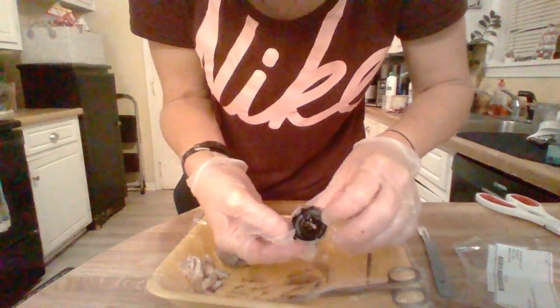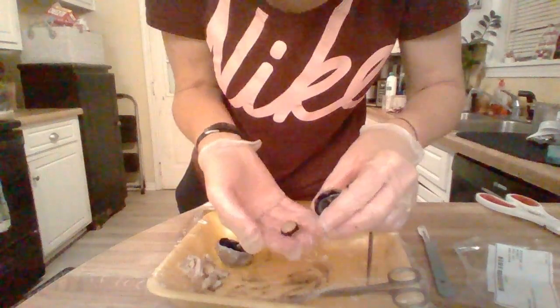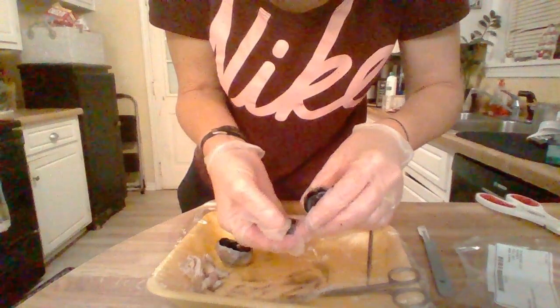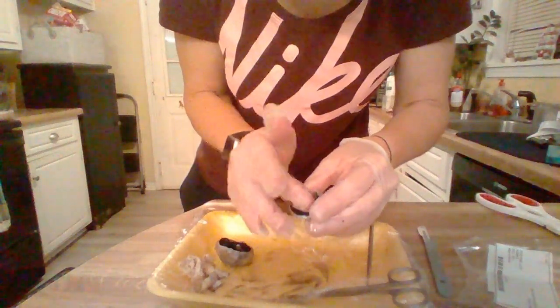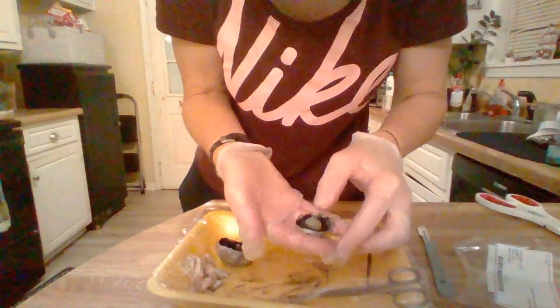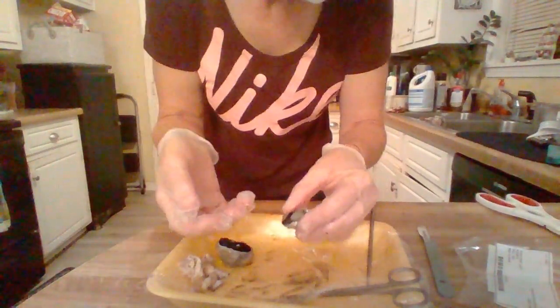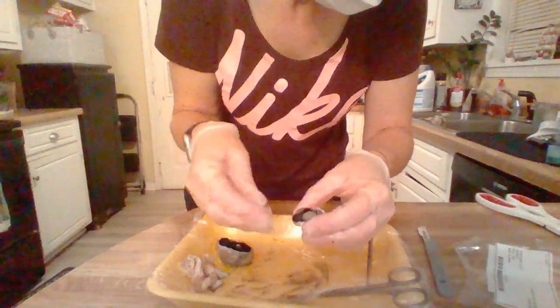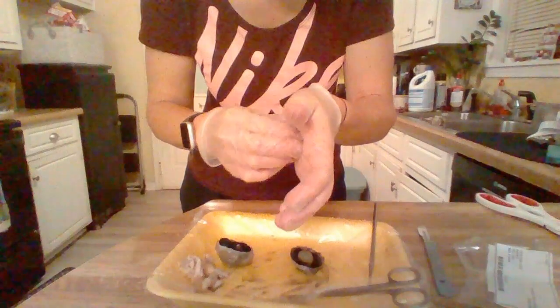You can see here the iris, and then the pupil, where that would be. And here we have the lens, which normally would not be that hard, but because of the preservatives and stuff. There's still a little bit of vitreous humor attached to the back of it. And those are the parts of the eye — I believe I just talked about each one. Thank you.